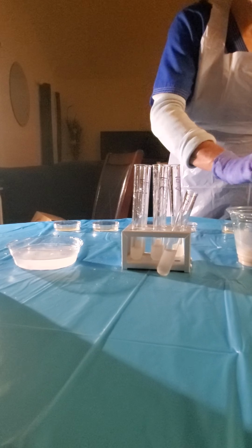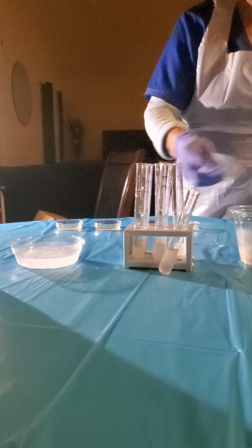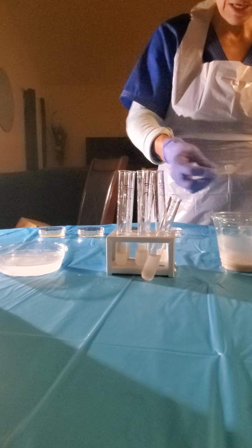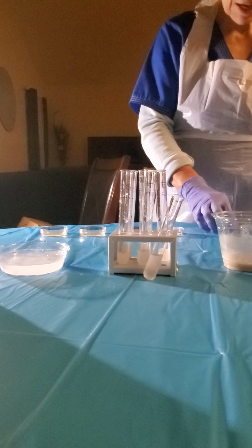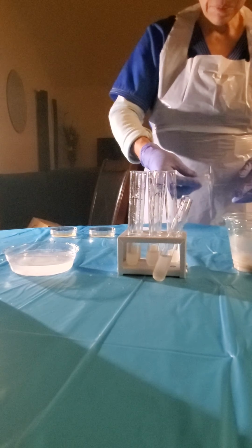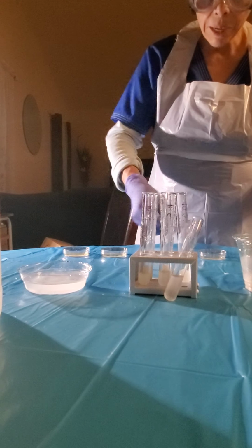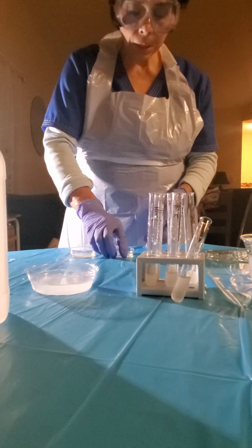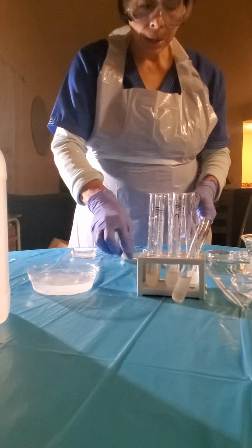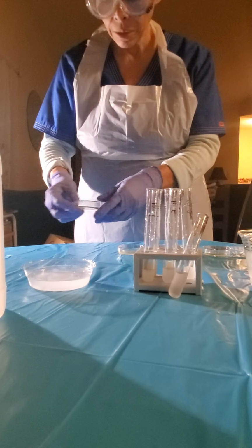So now we just want to take and move the liquid inside of our plates. Be sure that it expands completely. It has to be in incubation for 48 hours. Every 12 hours, turn it to allow the microbes to grow properly and evenly. So as of right now, I'm going to check this back in 12 hours and then turn the plate to allow the bacteria to grow properly. The idea to move it is to evenly spread it in the agar area.